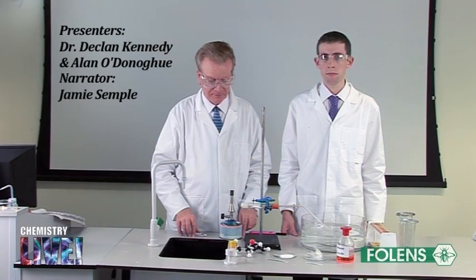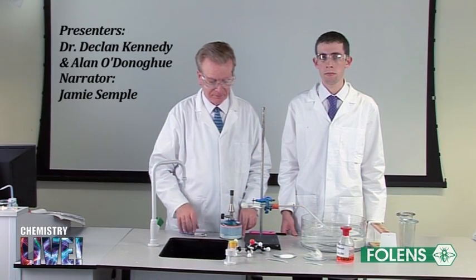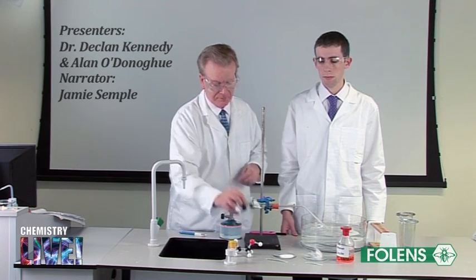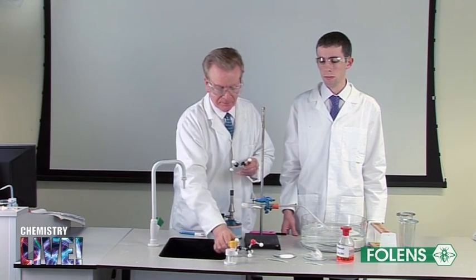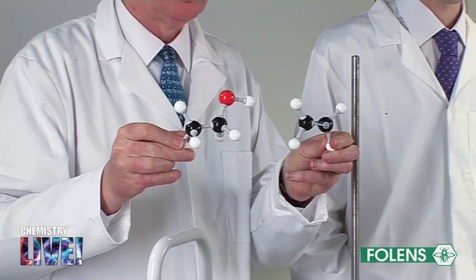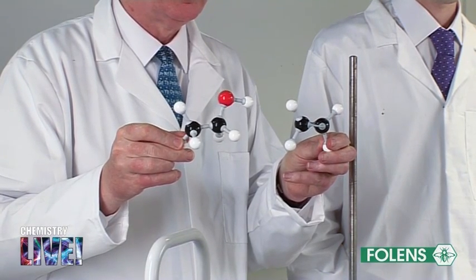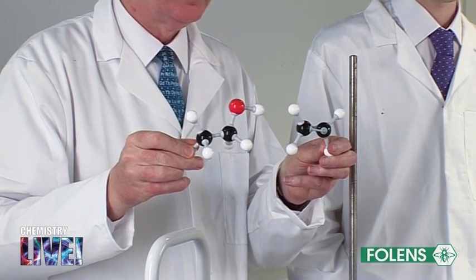In this experiment, we will prepare a sample of ethene gas by dehydrating a substance called ethanol. That is, using a chemical reaction to remove the elements of water from ethanol.